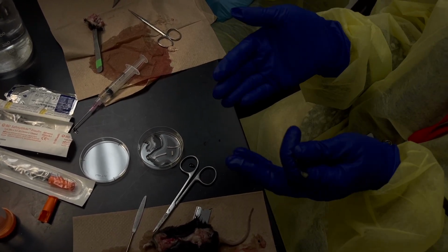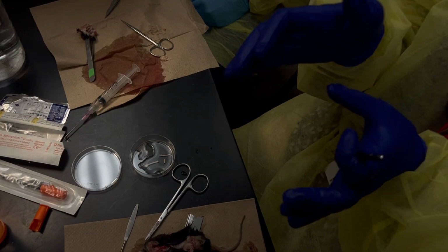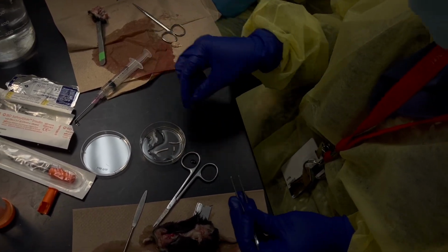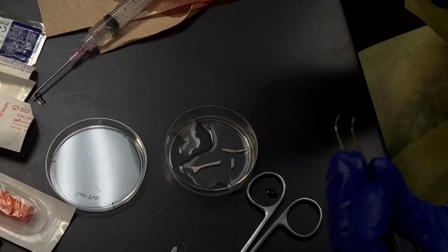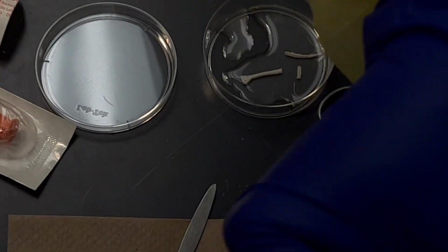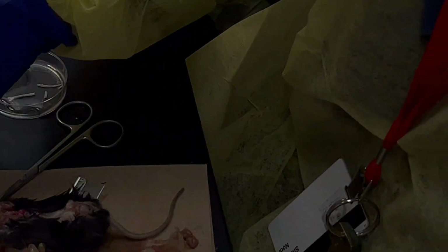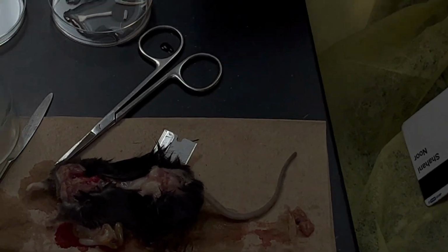Yeah. So what I usually do is try to at least make the cut when it's not super frozen. So I can actually show you really quick with this part, imagining that this is the lumbar spinal cord. So here. Can I get this? Yes, try it. This mouse has been in there for a while. Should I start with the next one? Yes. Let's get this one started.